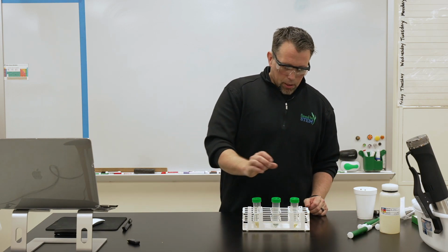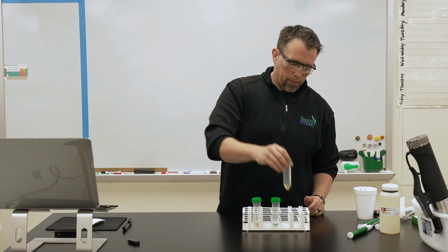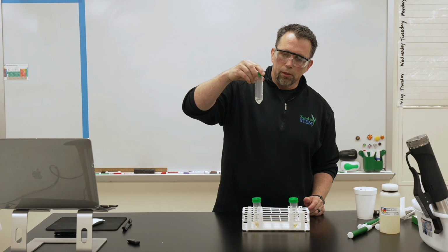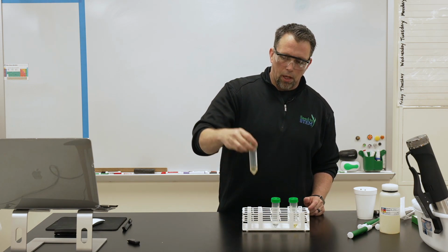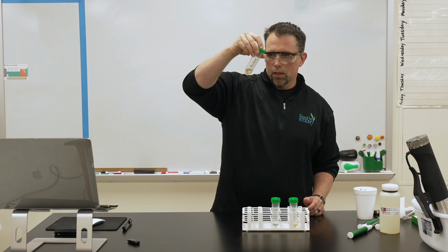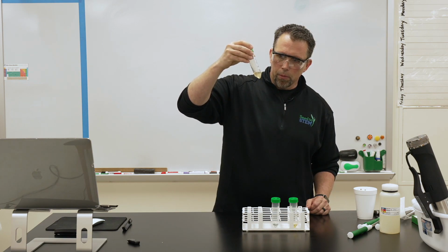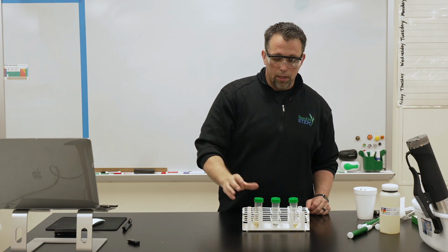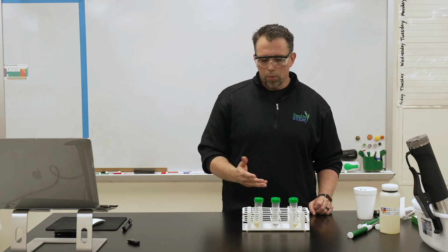Okay, so it's been about 5 minutes, so we'll go ahead and check these. Our corn oil disc doesn't look much different. The renewable diesel, since it doesn't have that methyl ester on the end, that hasn't changed. And our biodiesel disc has completely dissolved. You might see after 5 minutes a few little flakes of it, but it's pretty much gone. So again, newer engine designs have helped with that, where they don't use plastics or rubber materials that are soluble in the biodiesel, but the renewable diesel doesn't have solubility issues at all with plastic components.